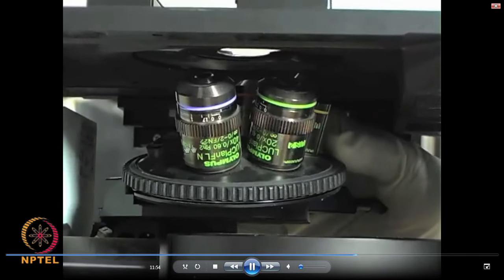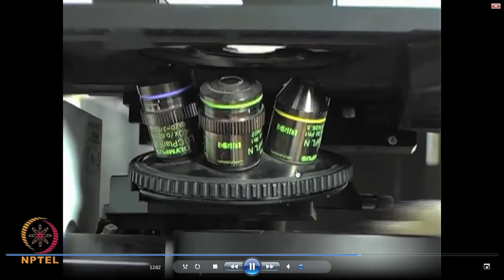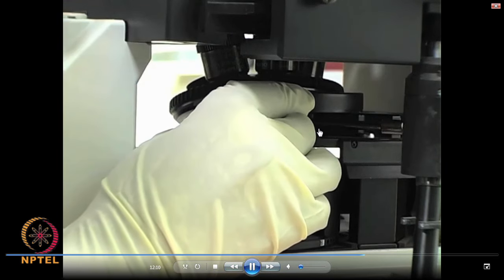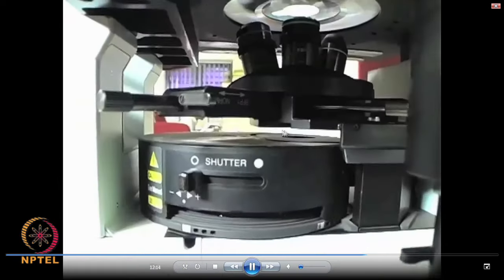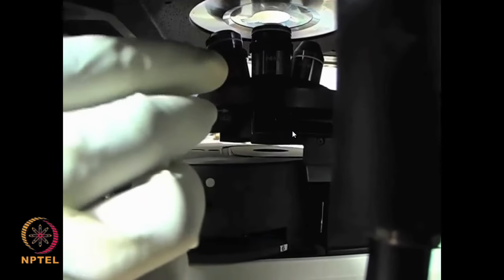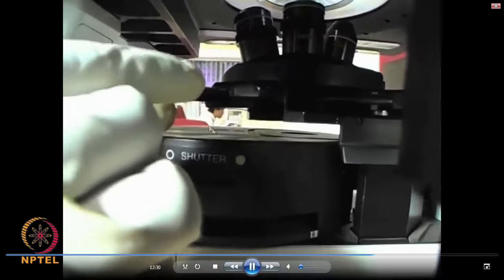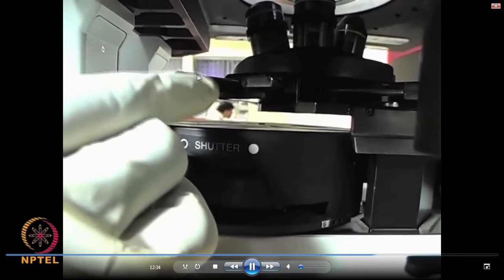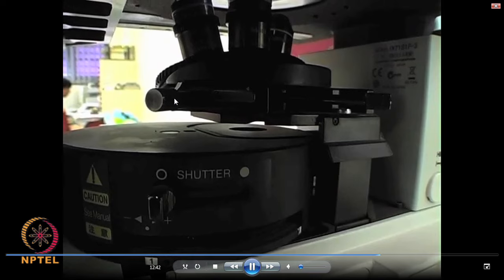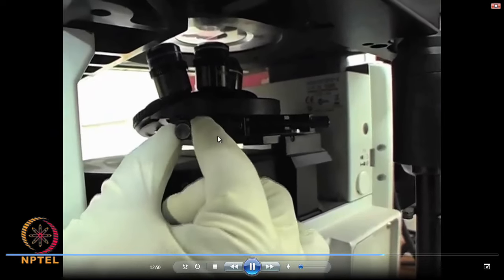If you have up to 50x or 100x objective, eventually you will have the magnification up to 1000x because your eyepieces will have 10x magnification. What you are now seeing is a part called the analyzer — the operator is just inserting the analyzer. This analyzer is used when we operate the microscope in differential interference contrast (DIC) mode, and by turning this knob you can make the preference of constructive and destructive interference.